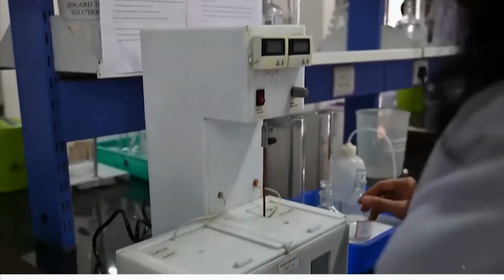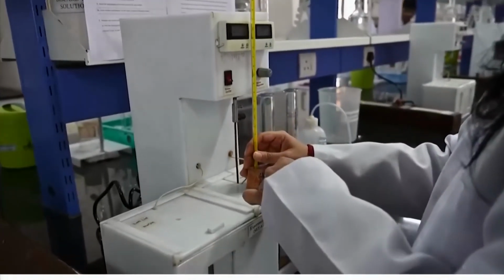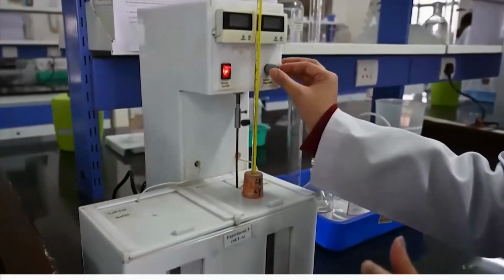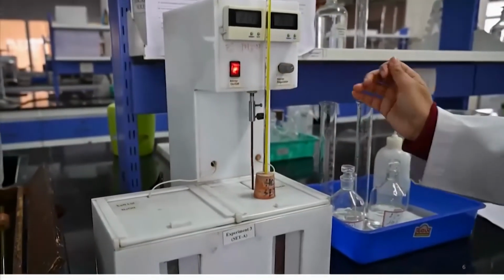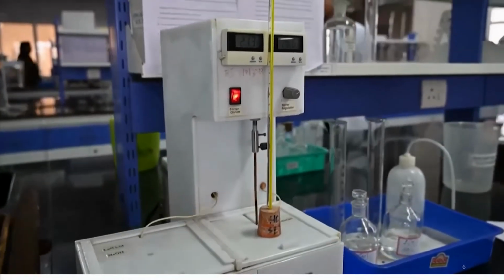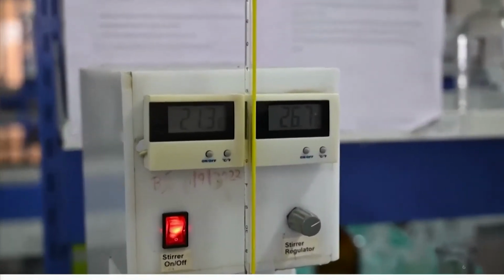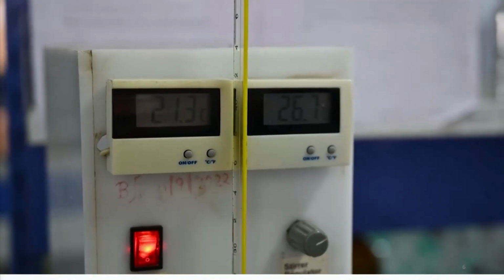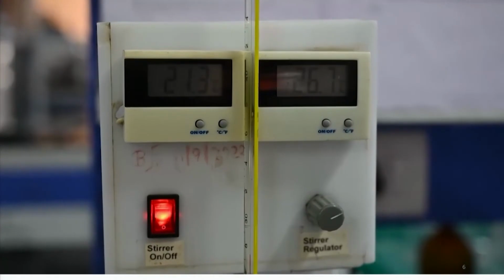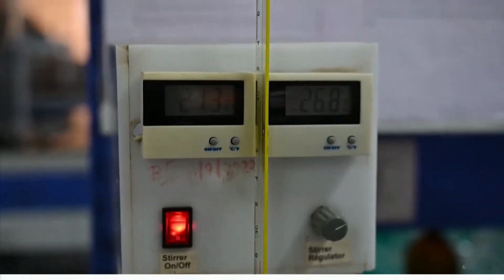Okay. Now, what I will do is reattach the thermometer in the acid alkali mixture, switch on the stirrer and stir it very well. Why do I need to stir? Because I really want to complete the reaction, in such a way that I start seeing the temperature changing over here because of the heat which is evolved as a result of the neutralization reaction.